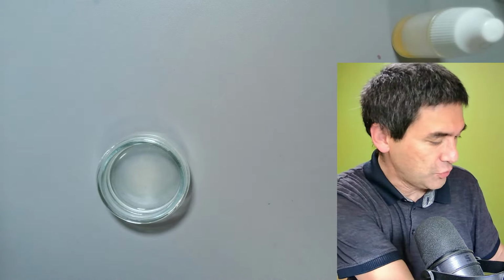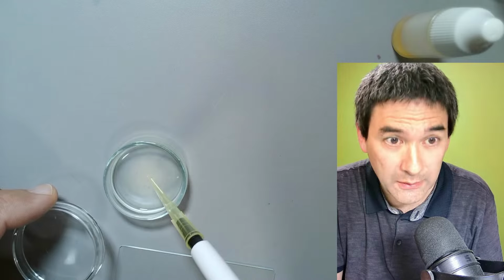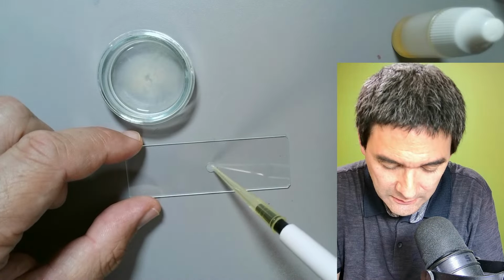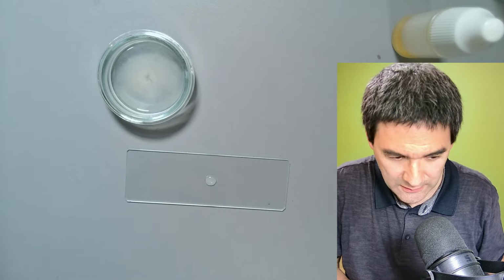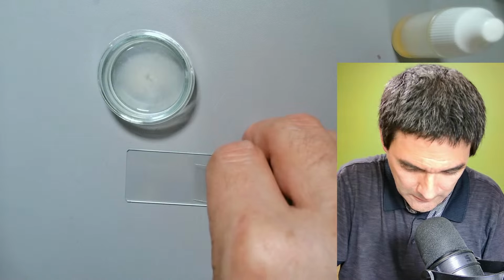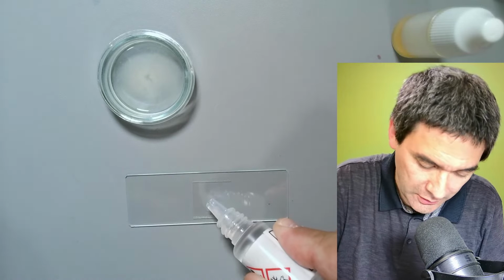This is a little bit strange, really, that there are so many other cells here. I will take a small sample here again. We put it on the slide. I drop the tip. Going to wipe this. So here we go. I'm going to try the following. You know what? Why not try to put the oil directly on here?